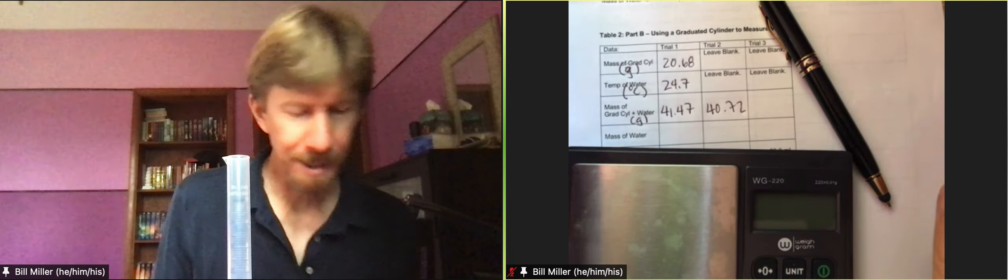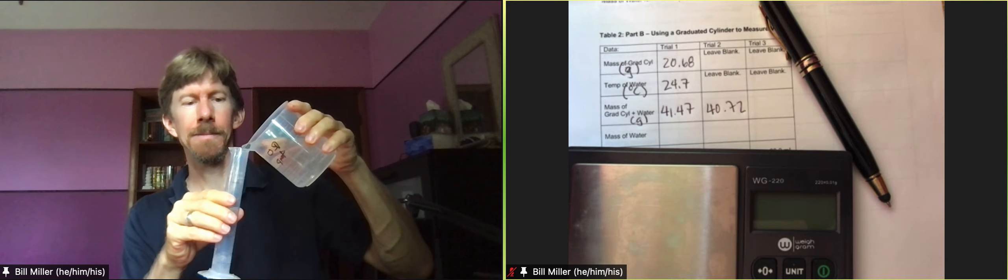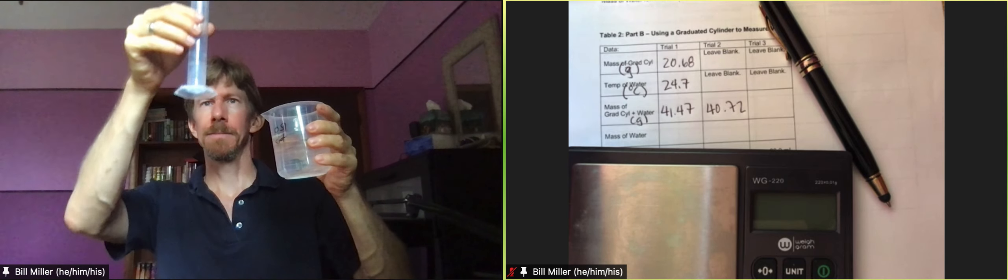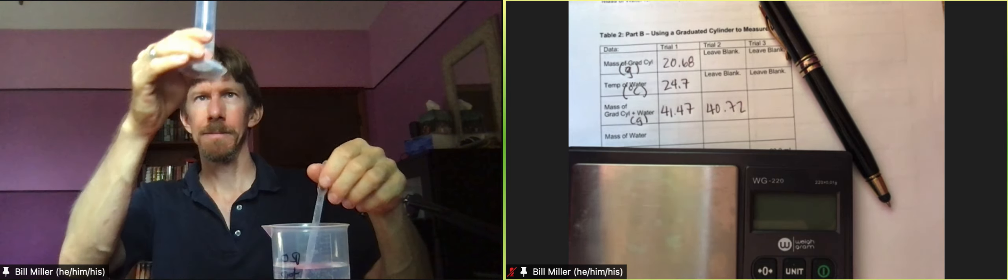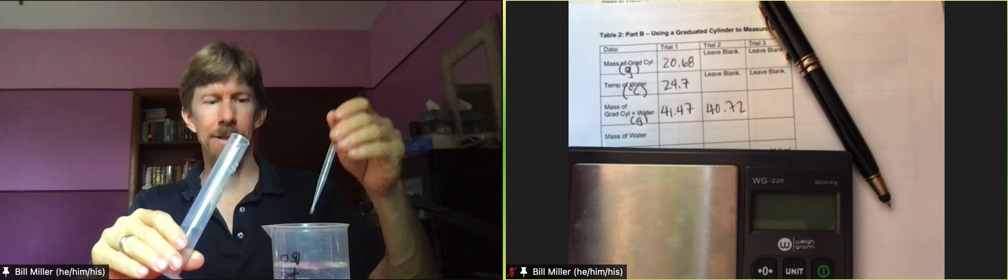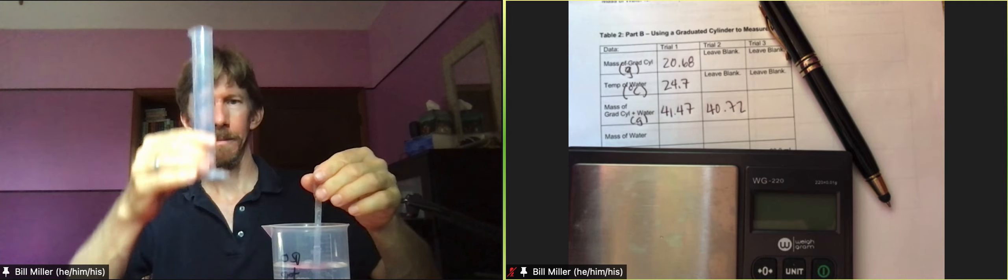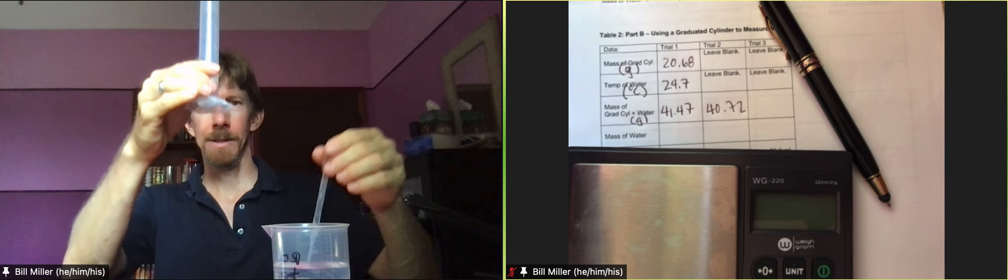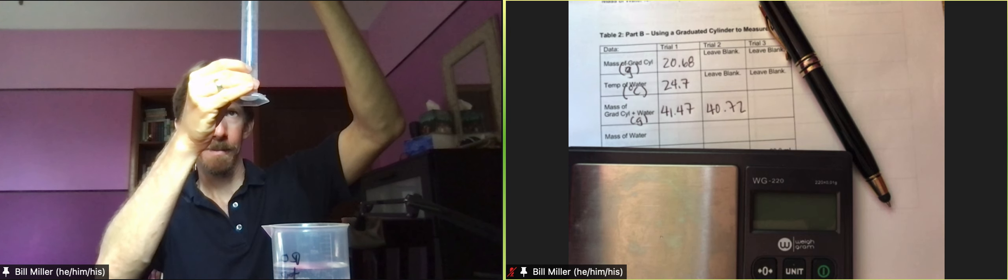Repeat the measurement and record the mass again. So here we go. That's pretty good but not perfect. Actually I think about time I got a little, pour a little out. All right, so let's fill it up looking straight across. There we go.